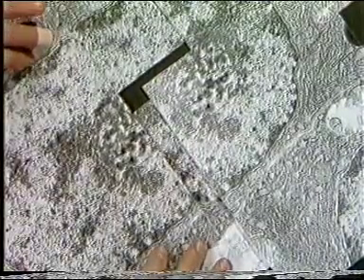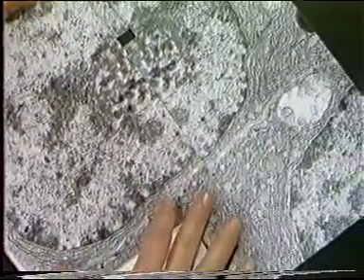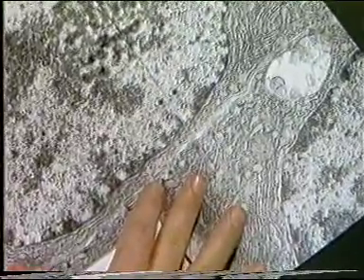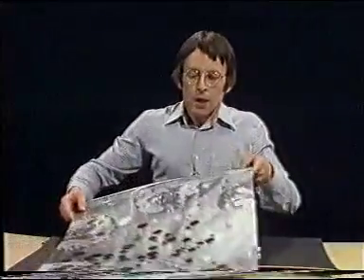Here I have a number of photographs taken at a magnification of about 44,000. And I'm piecing these photographs together in the region of the nucleus. This fits quite well together. I'm just matching up the nuclear envelope. Here is a completed montage of the same pancreatic acinar cell.